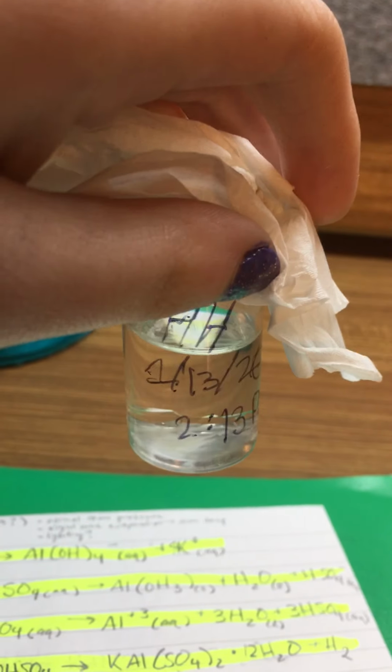They look to be about 1 millimeter wide on average, and they look very geometric, which is good. That's how crystals do form. They're clear, and I think progress is going well so far on the growth end of things.